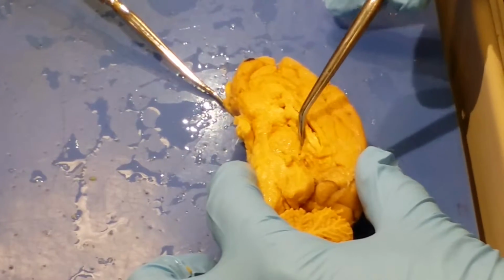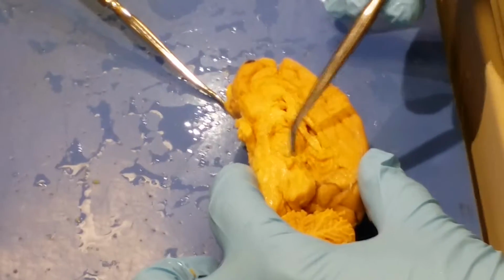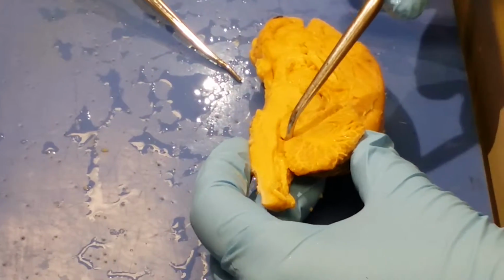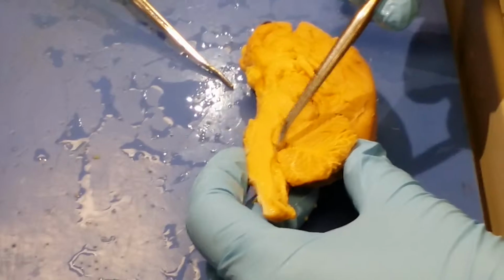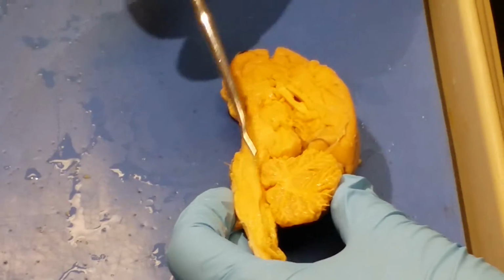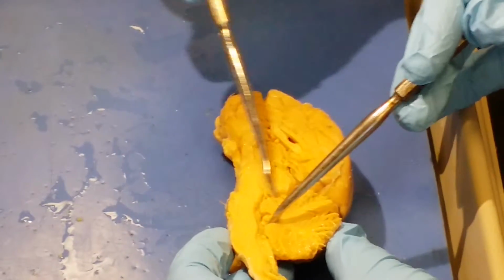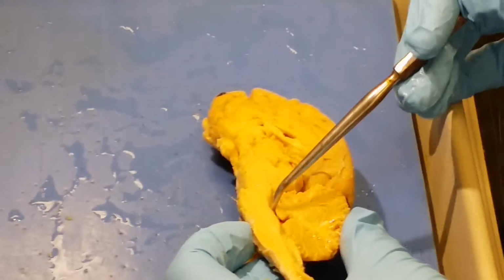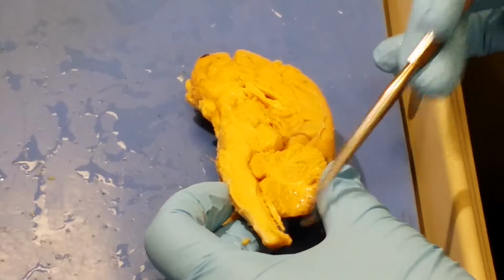Third ventricle is the space surrounding the thalamus. Fourth ventricle is down by the cerebellum, right here where the cerebellum meets the brainstem. So it's just, I'm sorry, it's just this small gap, it isn't all this? Just this right here. I see. That right there is the fourth ventricle. Okay. Yeah, that would be your cerebral aqueduct, and then this is going to head into the spinal cord.